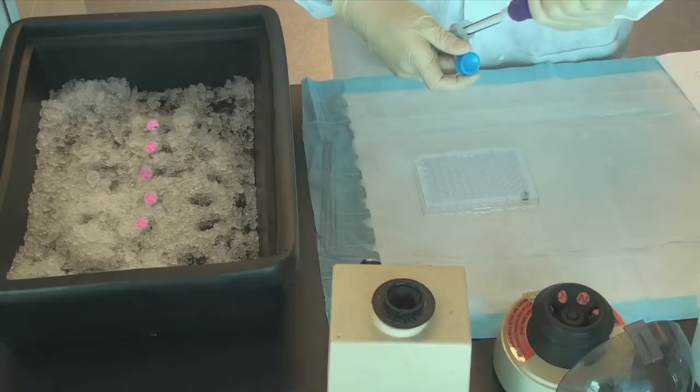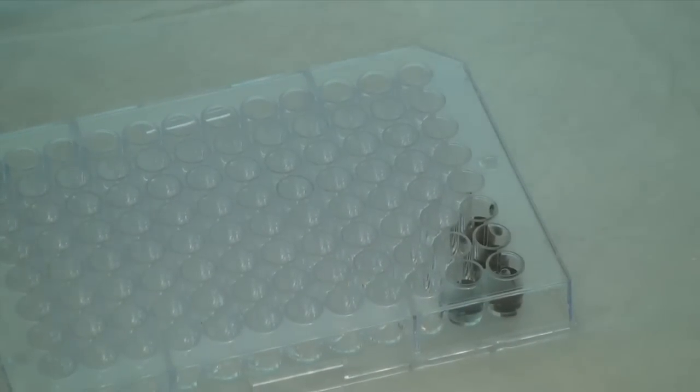The color change has finalized after 15 minutes and it remains stable for at least one hour.